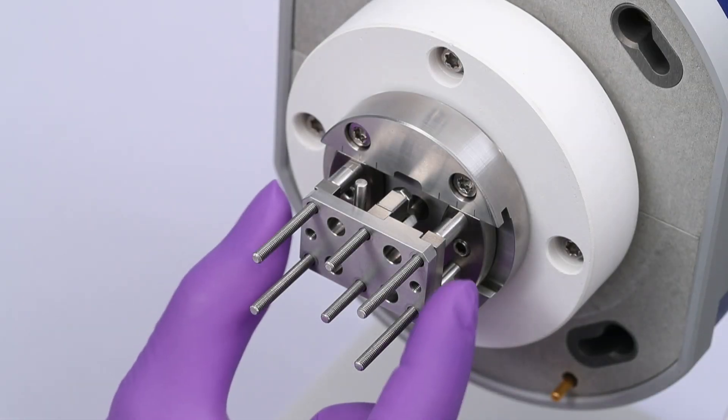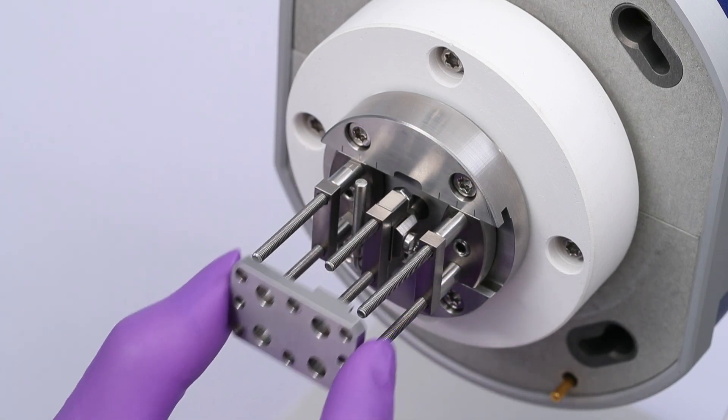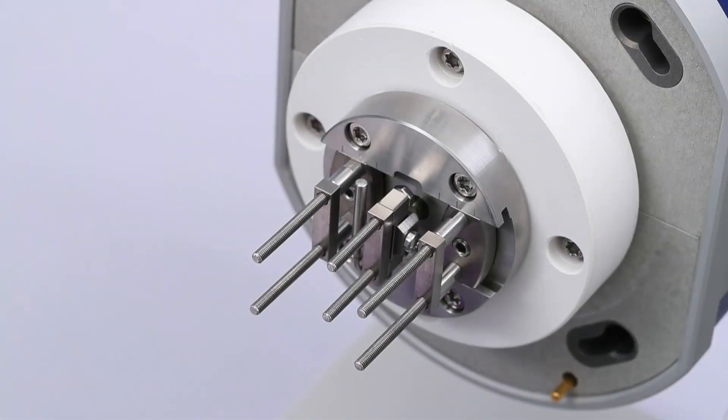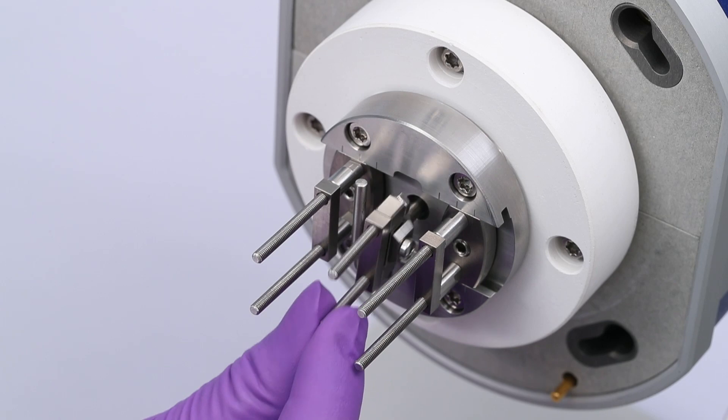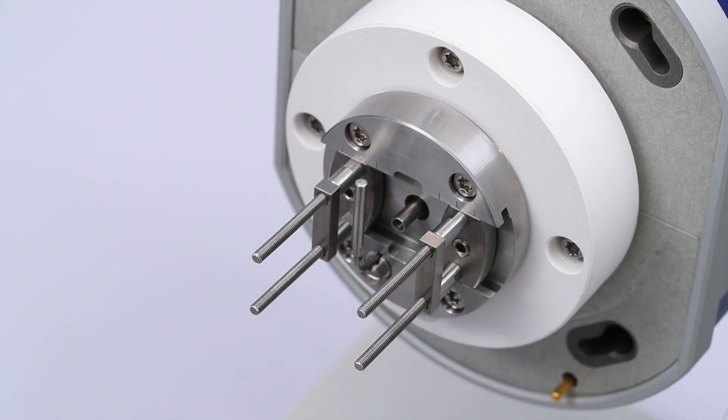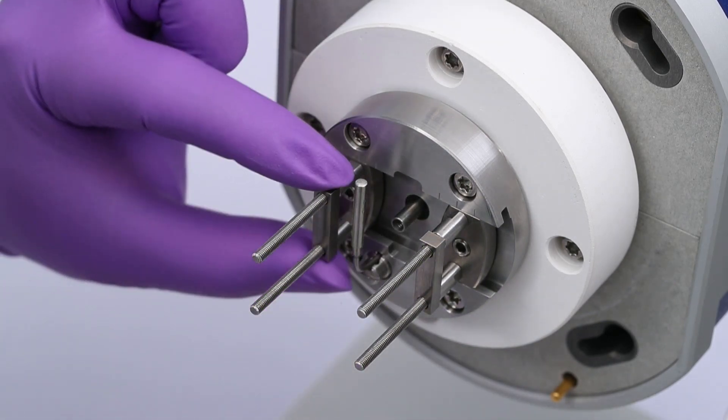This permits the alignment insert to slide off easily. Carefully remove the bending drive shaft clamp. Remove the clamp bars on the outer clamps.